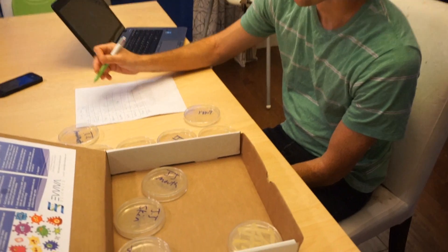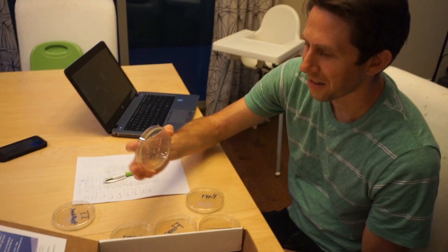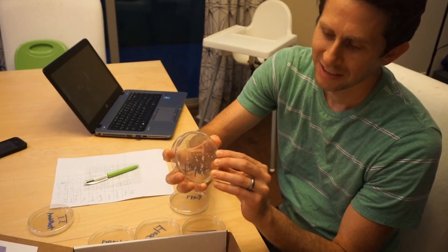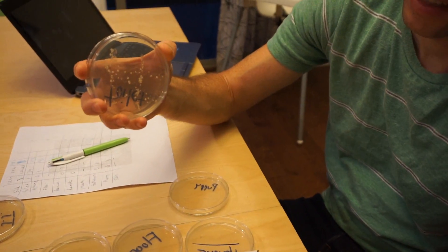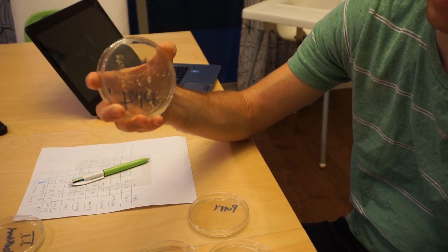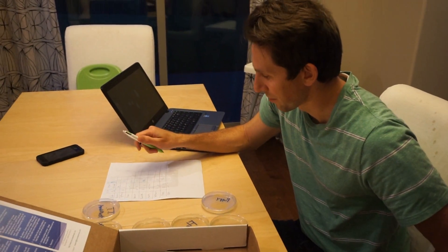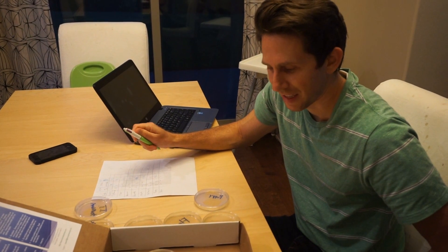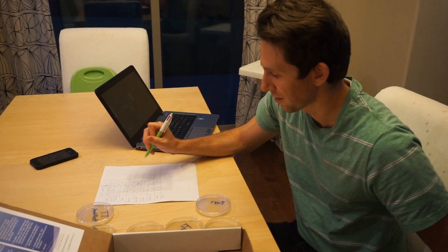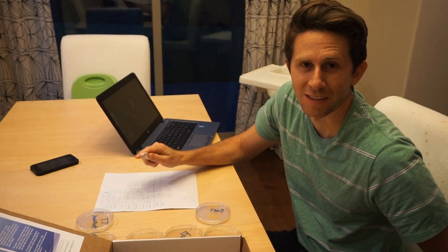At 48 hours, there's a lot of stuff growing, so I'm needing to do some estimations. The toilet's really growing a lot, and my mouth is growing a lot. The way I'm estimating is by counting per strip how many there are and then multiplying by how many times I did it. So far the cleanest thing with no growth at all is my toothbrush, and my skin has only one more colony growing.